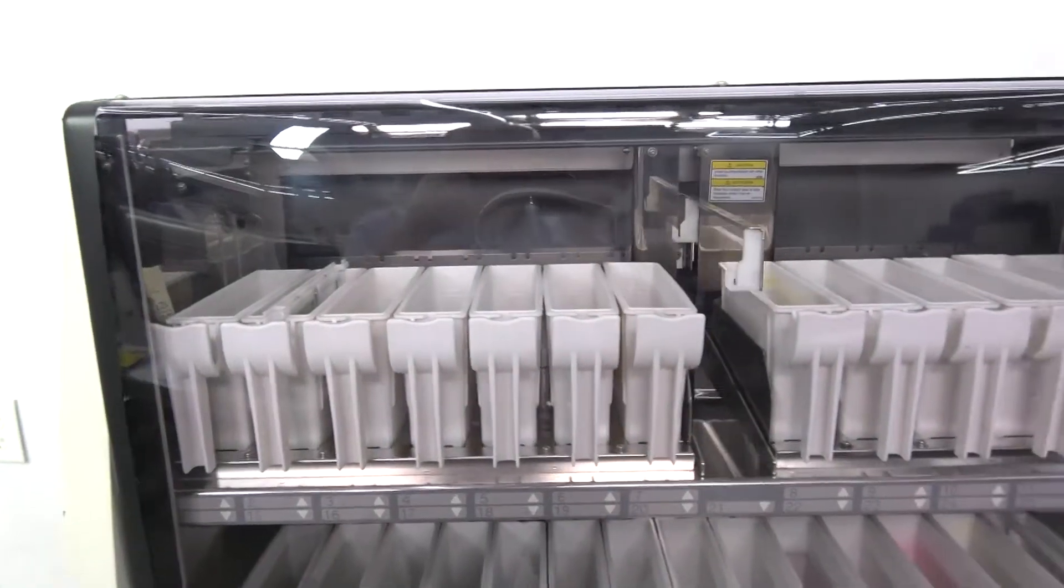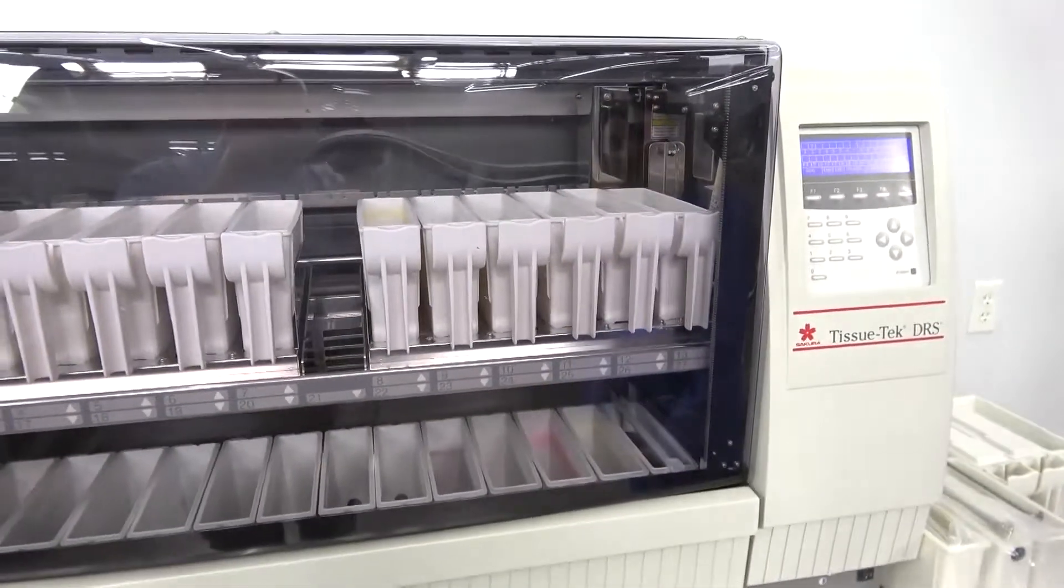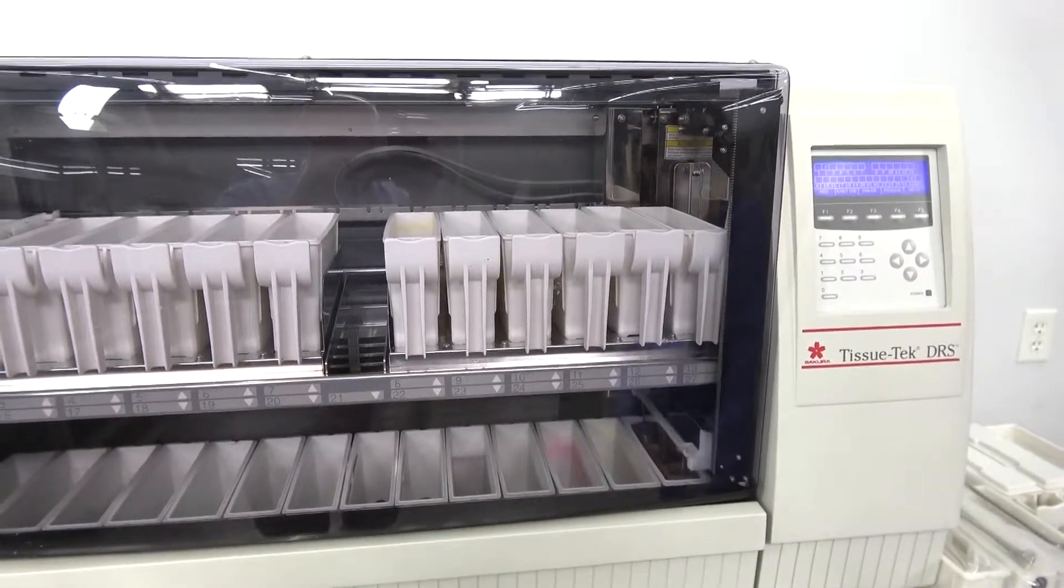This unit is equipped with everything that you need to start running it. And as you can see here it's going to pick up the second run and start that.